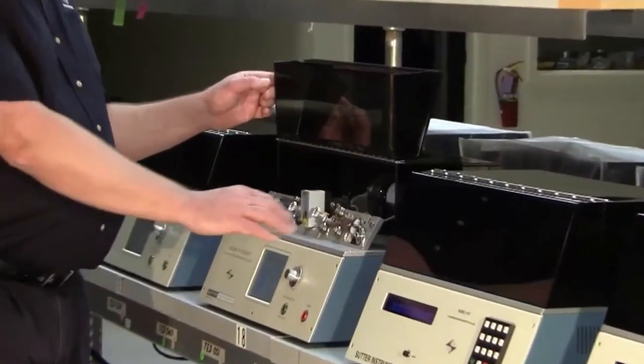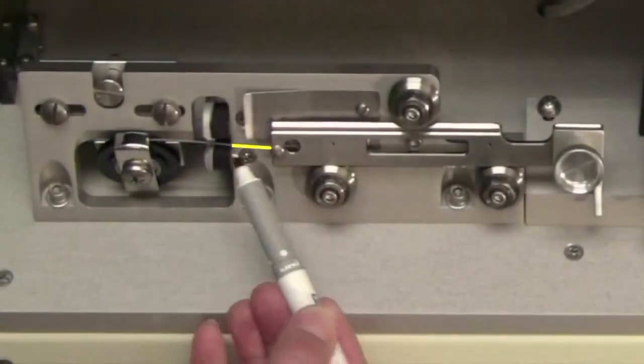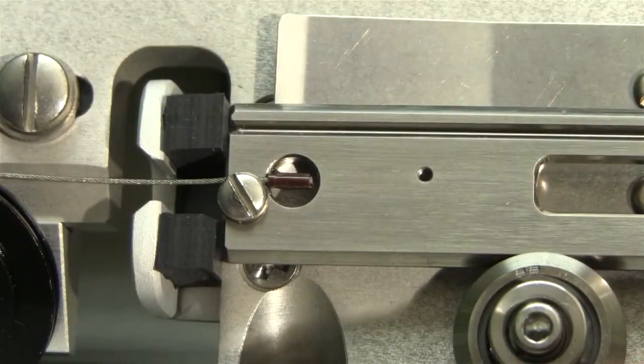The pull cables are attached to the ends of the puller bars on each side. They are routed around the upper pulleys and then over a pair of lower pulleys underneath the base plate and on to the pull mechanism. First, let's make sure the pull cables are properly attached.